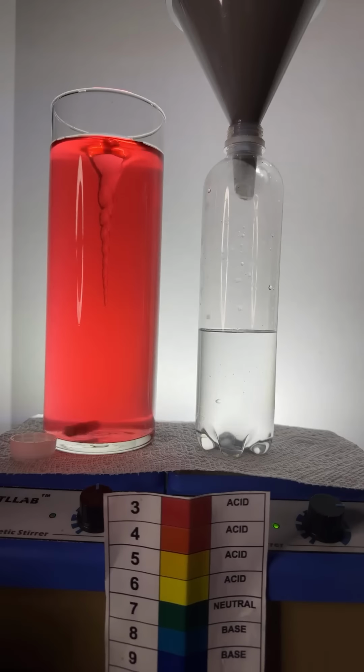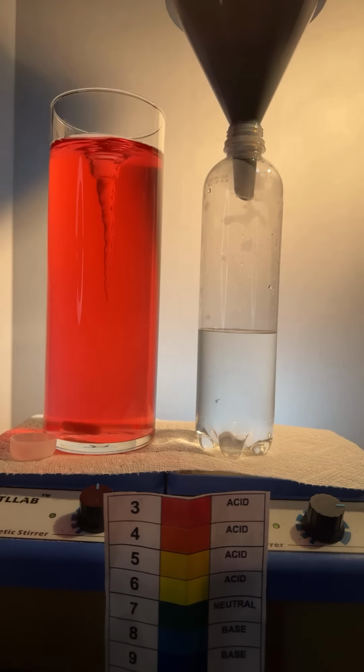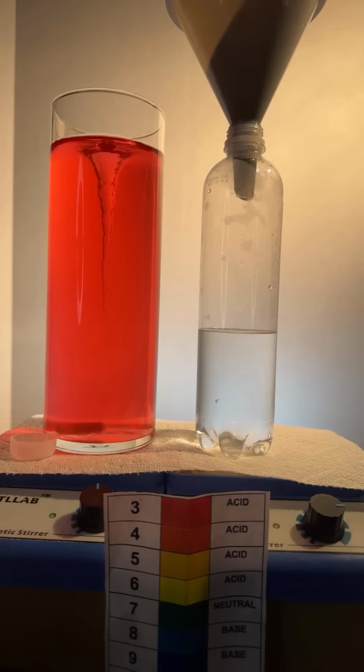See if I can find my acetone. Here it is. All right. Add in the acetone. Uh-oh. I got to get the bottle open. Let's see if I can find my scissors here. I apologize for the delay. Yep.